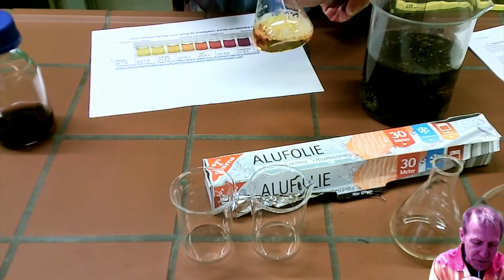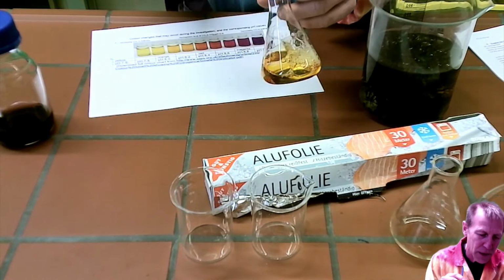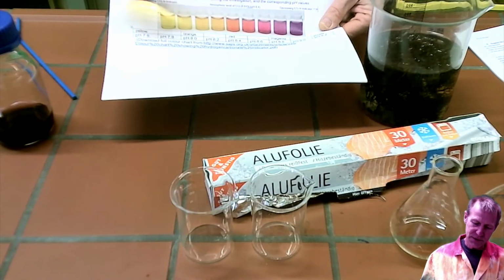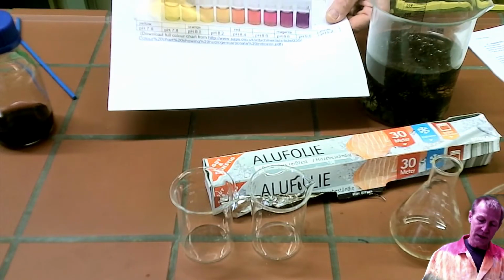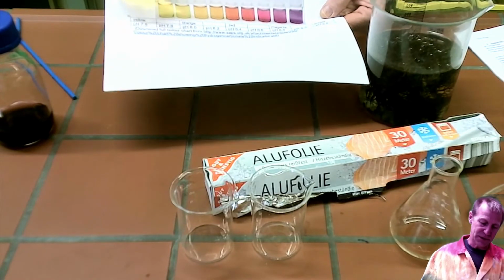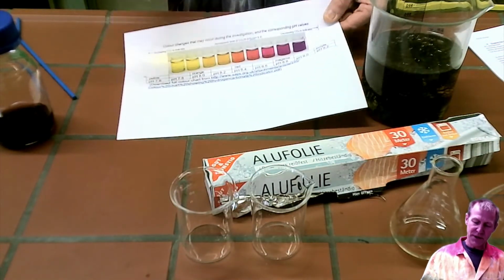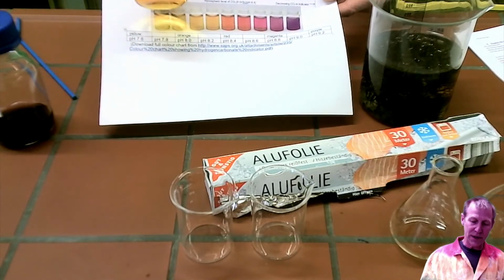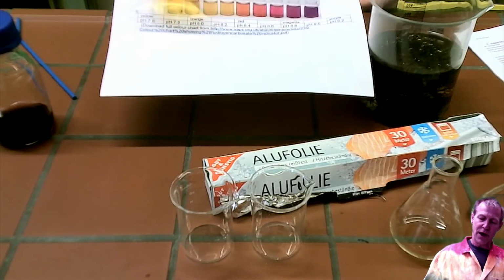Sounds a bit like an aquarium shop. Okay, so now if we compare this to our scale, we are now on the other end of this, somewhere in the pH range of 7.8 to 8, a pH of 7.8. Maybe it is even closer to 7.6. So this might not be the best scale because it doesn't expand all the way to the ends. But it gives you an idea of how this solution can be used to measure the amount of carbon dioxide. So I just blew into this solution, which was over here in this purple range. We're now in the yellow range.